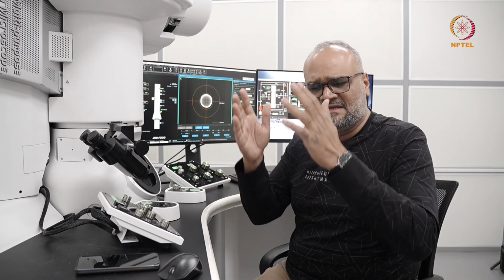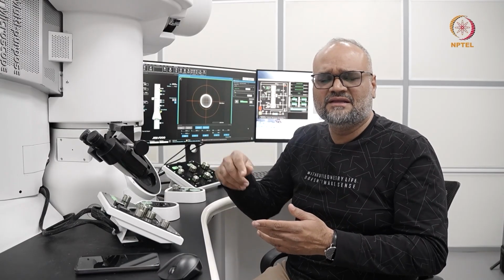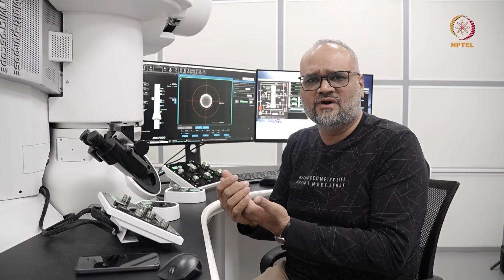Now I'll show you how to image in STEM mode. The main difference between STEM mode and the other modes that you've seen here is that previously you had the electron beam arranged like a cylinder, and you have an interaction of a parallel beam with the specimen. Here you are converging the beam to form a sharp point or a conical probe, and you raster through the sample, and you're collecting all the forward scattered signal to form an image. How do we do this?